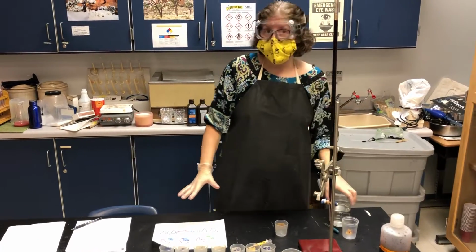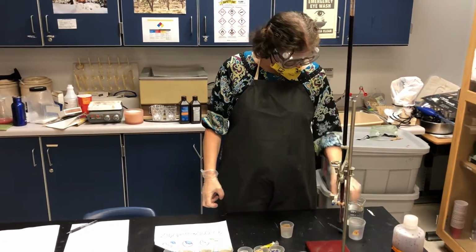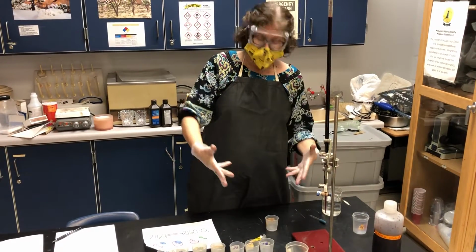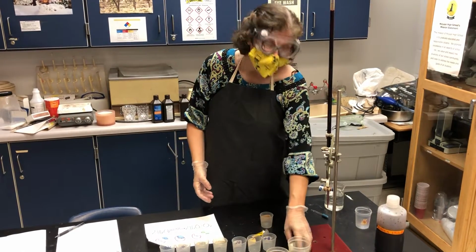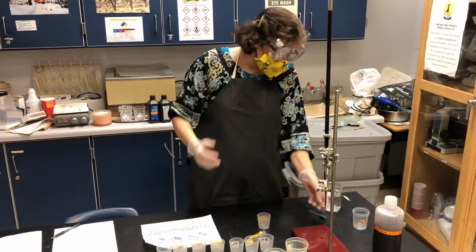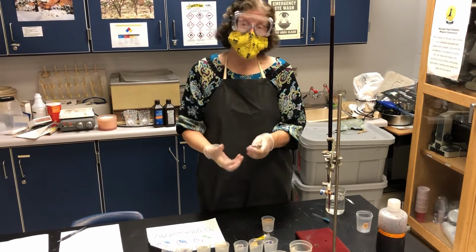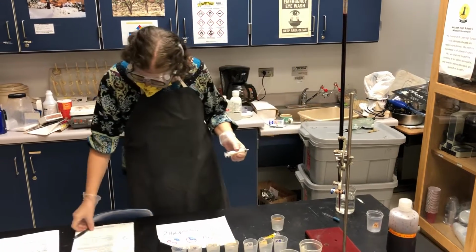This is not the lab that you're going to be doing in class with me. This is a slightly different lab, but because it gives some really good quantitative results, I wanted to walk you through it and use it as an example of how you can measure the exact rate of degradation of substrate by an enzyme in an enclosed environment. That's what we're doing.